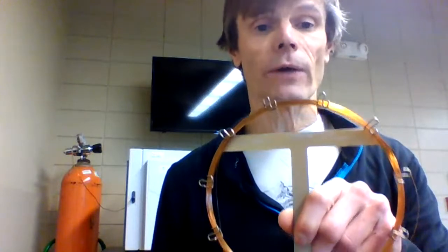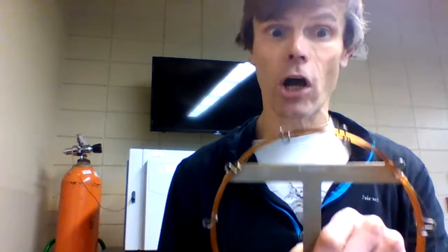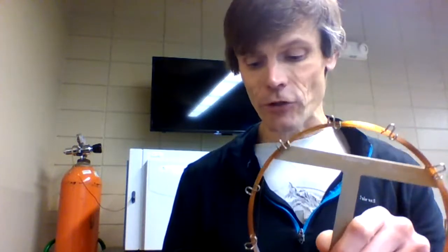Pretty long column. Typically, for our open tubular capillary columns, the lengths will be anywhere from 15 to 100 meters. Long columns give us a large number of theoretical plates, and they give us superior efficiency in comparison to the packed column. Their diameters are very small, anywhere from 150 to 300 micrometers. So they're pretty small in diameter.